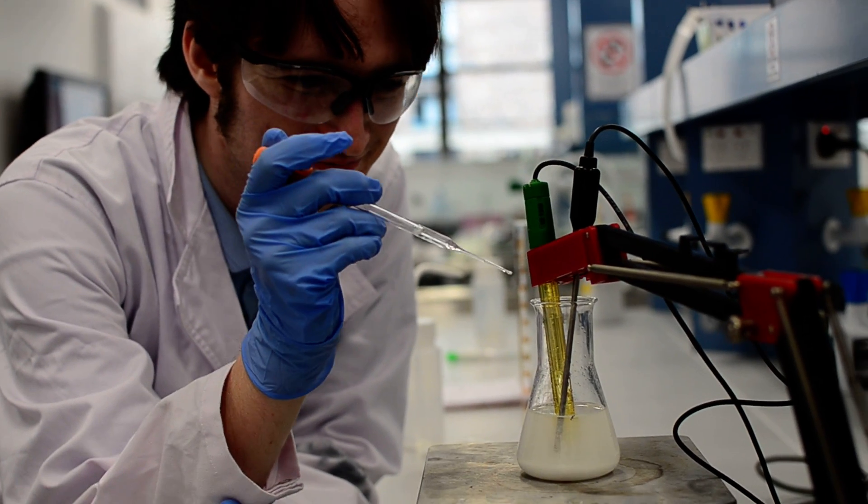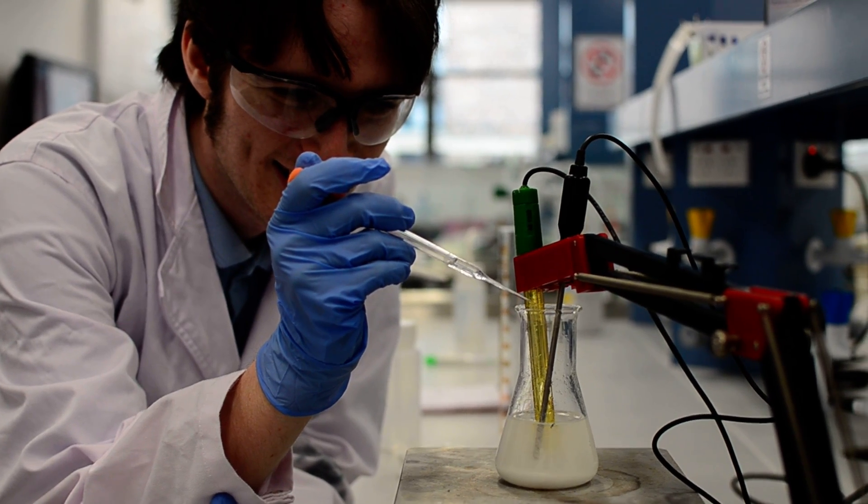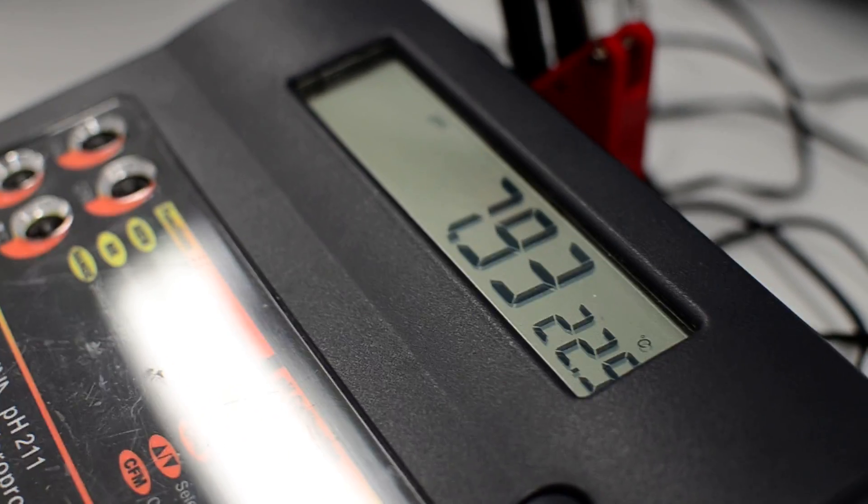No. What do you mean by that? One more drop. This is really cool. Sure.